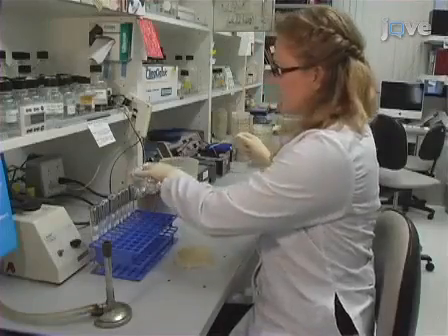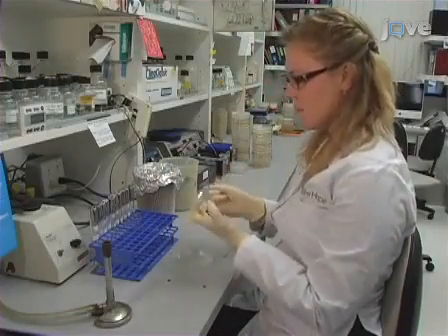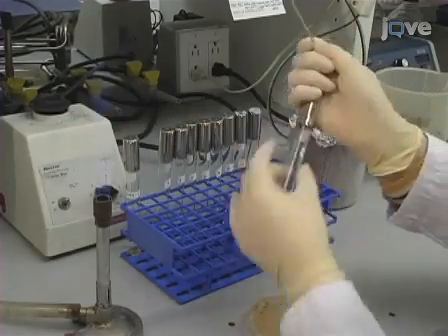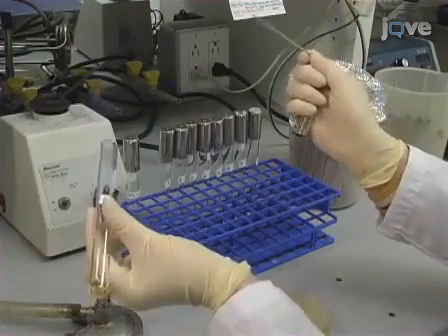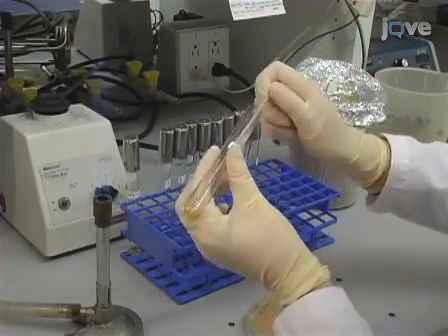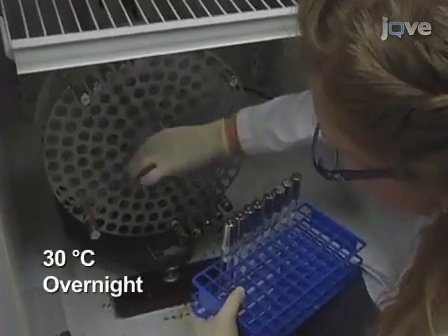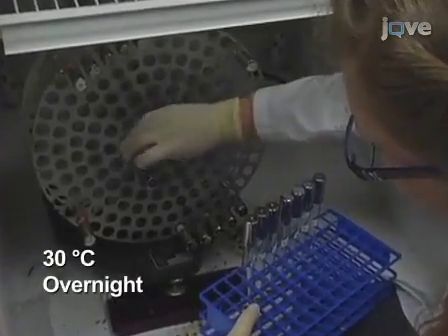To begin the procedure for determining HO-stimulated translocation frequencies, inoculate 10 to 20 independent 1 milliliter cultures of YP glycerol lactate medium with single colonies of the desired genotype. Incubate the cultures overnight at 30 degrees Celsius on a rotator.